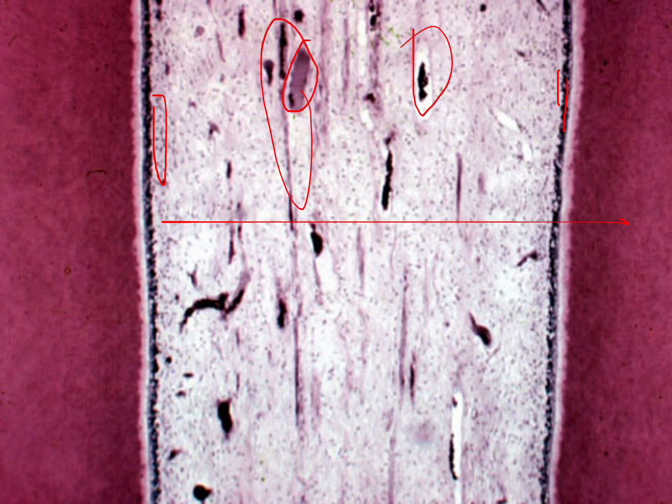This is a lower magnification showing a root where there are odontoblasts, almost no cell-free zone, the cell-rich zone, and the pulp core. See here the nerves, the blood vessels with the lumen. You can see the neurovascular bundle.